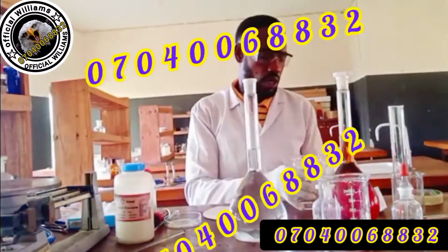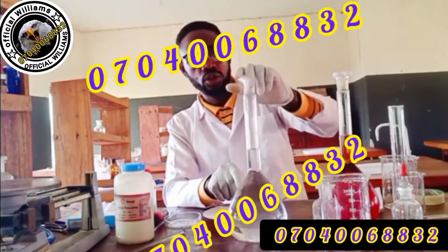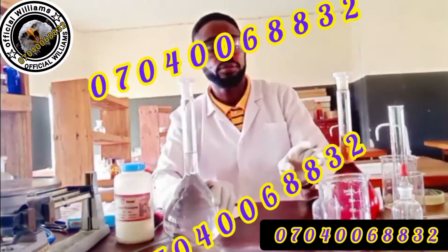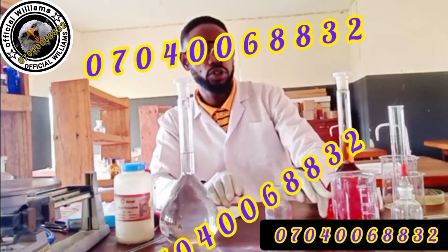There. Avoid error due to parallax. Please examine the meniscus. So solution B is here, and our job is done. So first step. Then the second thing is, what must you now do?